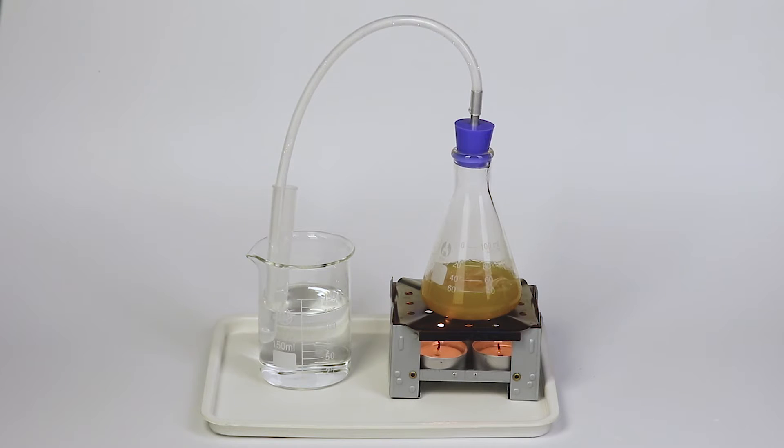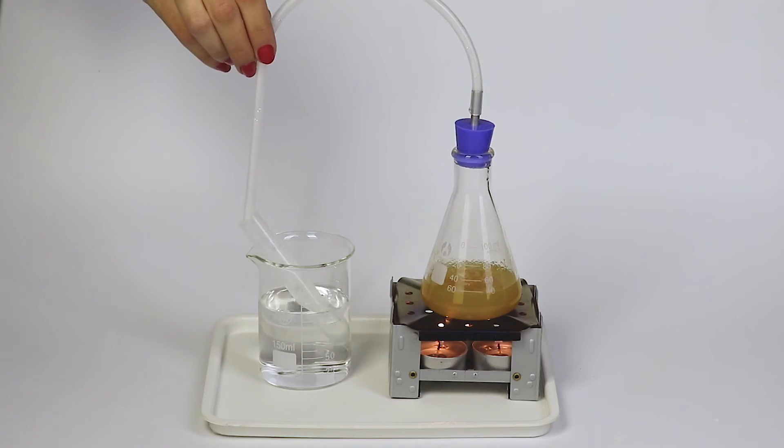The water in the beaker, which the test tube is placed in, cools down the vaporized fragrant substances, along with the water vapor, back to a liquid state. As a result, the essence collects at the bottom of the test tube. Chemists call this process distillation.